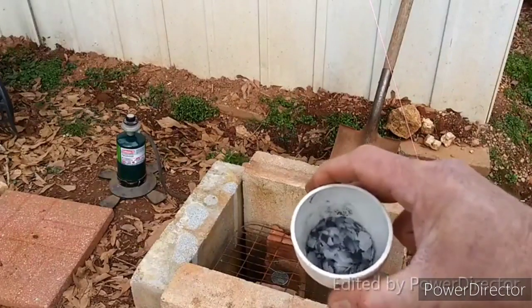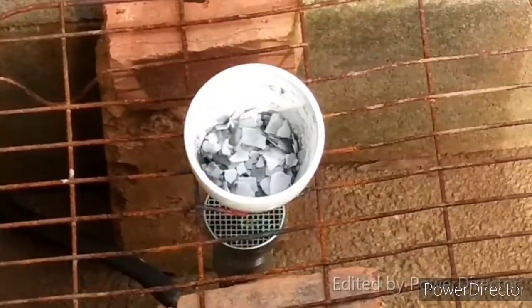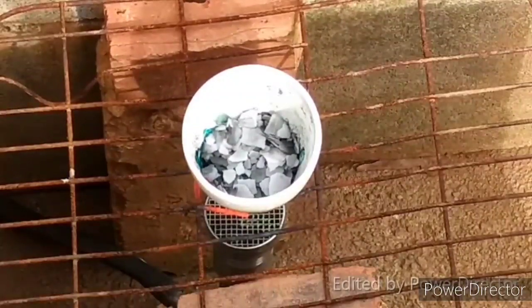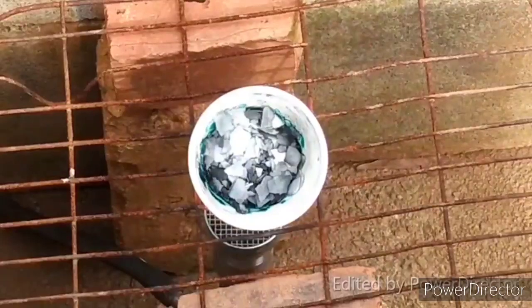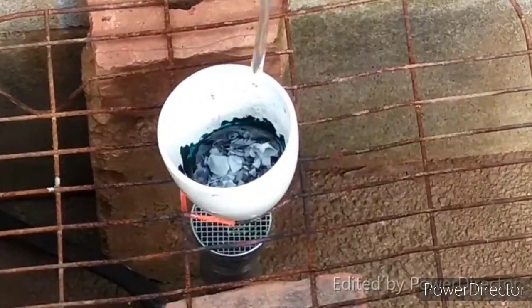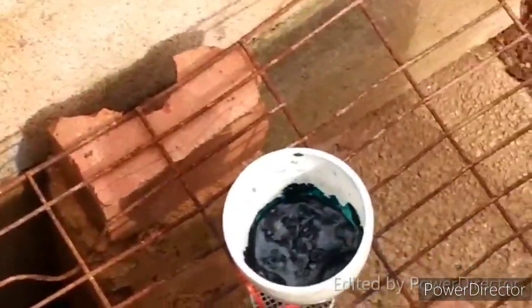The paper says to let it go for an hour. What will happen is the black manganese dioxide will turn dark green. I'm just going to watch for that color change. It's over a low flame right now — oh, it's already starting to happen! That was faster than expected. Crucible tongs might be helpful here.